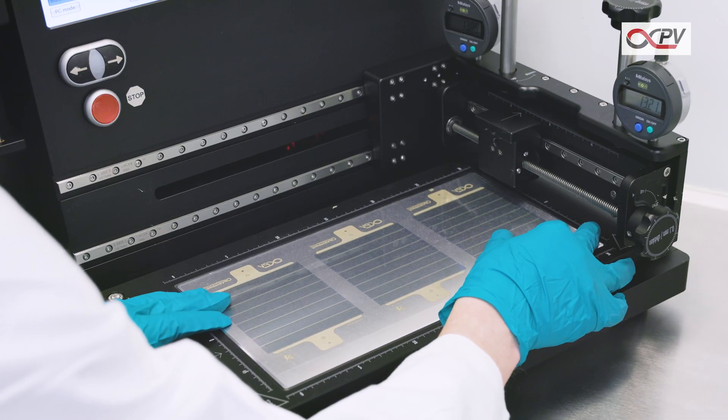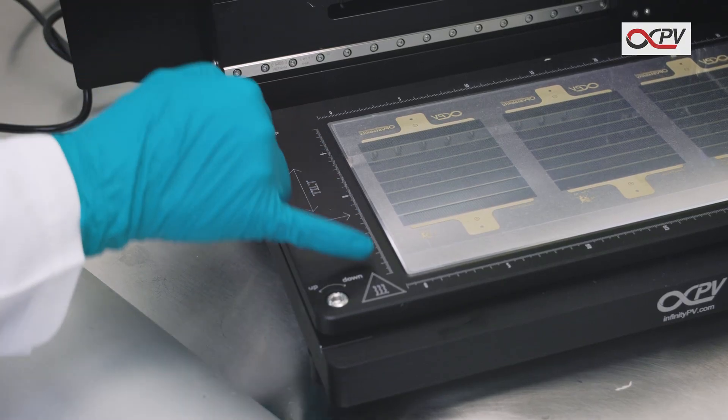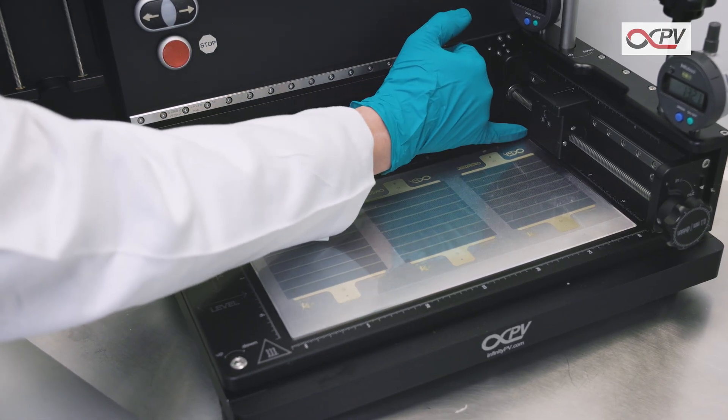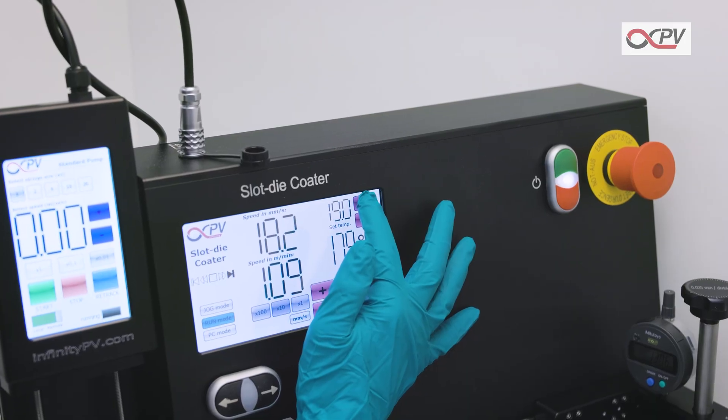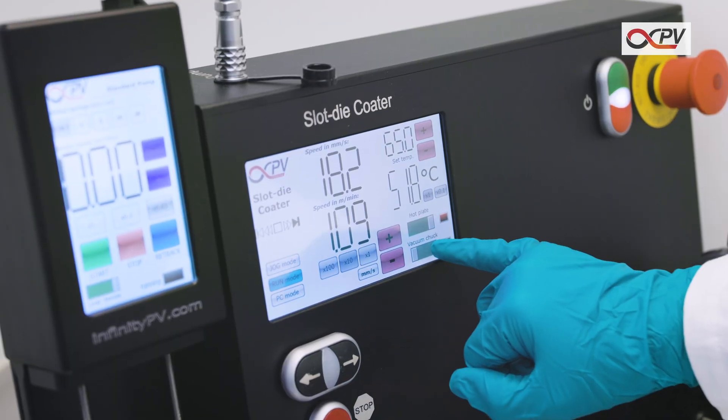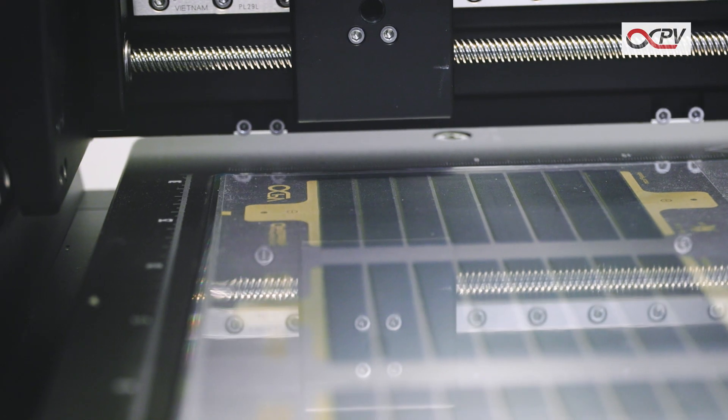Cut a piece of substrate and place it on the vacuum chuck. Make sure to align the substrate according to the coating direction. Set the base temperature and turn on the hot plate. Finally, turn on the vacuum chuck to secure the substrate.